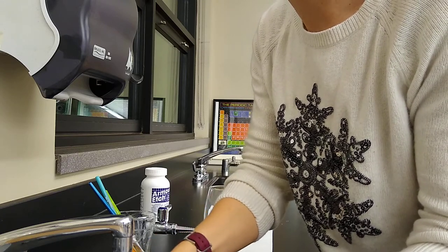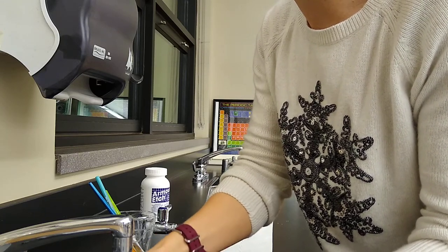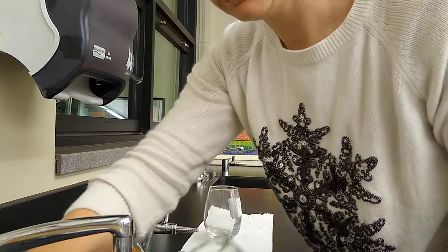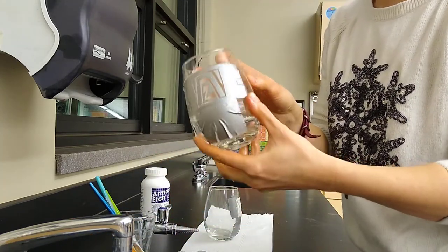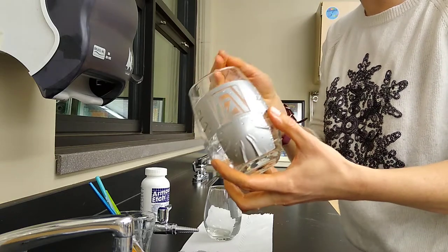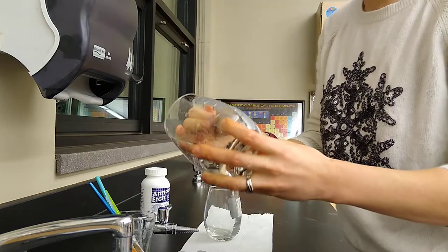You can be gentle or more vigorous with that, doesn't matter, just don't break your glass. It's not going to look like it's etched until it's dry and you have a contrast with the unetched glass.